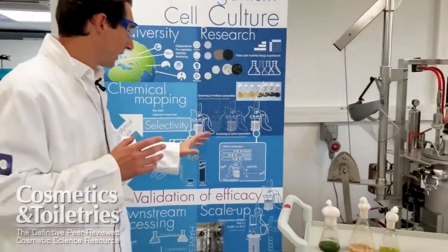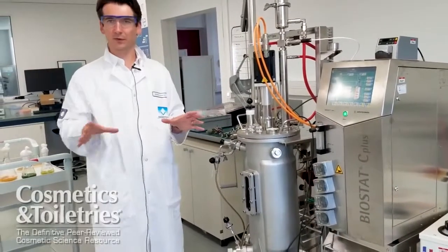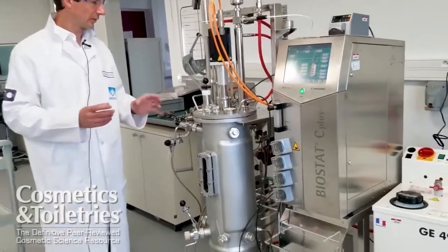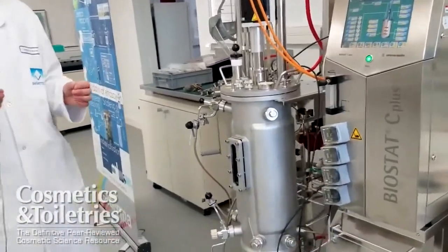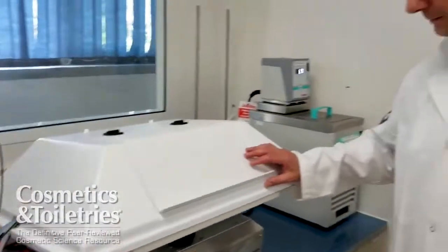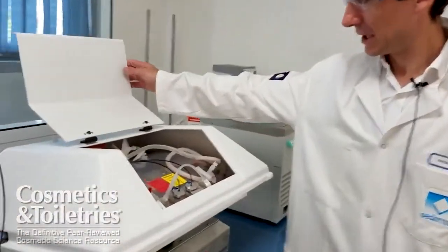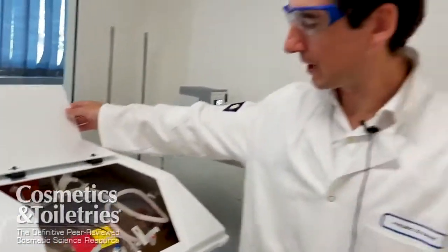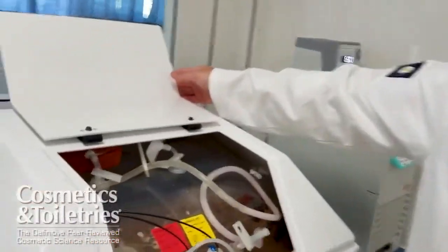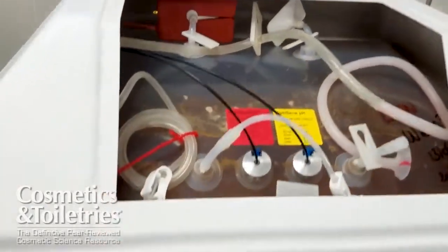How do we do that? We work in the bioreactors by playing on different parameters and on the biomass itself. We do not use GMO organisms; we work on culture conditions and process parameters to optimize our biomass.